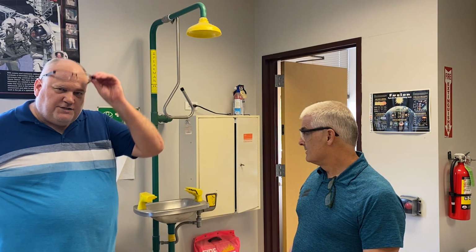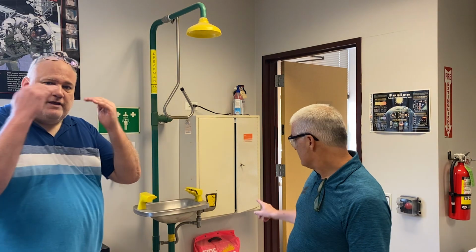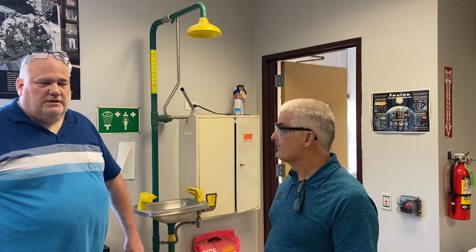Now, seriously, folks, that was sort of fun and silly, but if anything ever happens to your eyes, what are you going to do, Mr. Bergmann? You come here to the eyewash station, you're going to hold your eyes open, and you're going to push this lever down, and it's going to irrigate. Now, push this lever, and it's going to make a mess, but your eyes are way more important than a mess. And let's hope you haven't used a chemical that's going to damage it permanently.